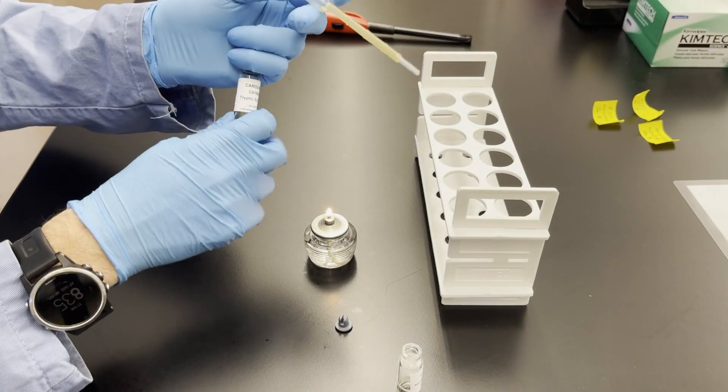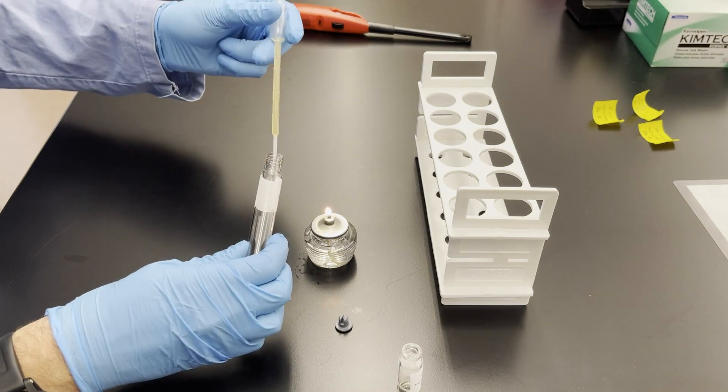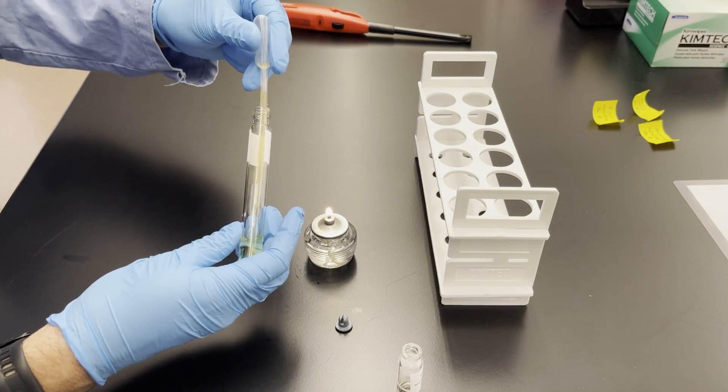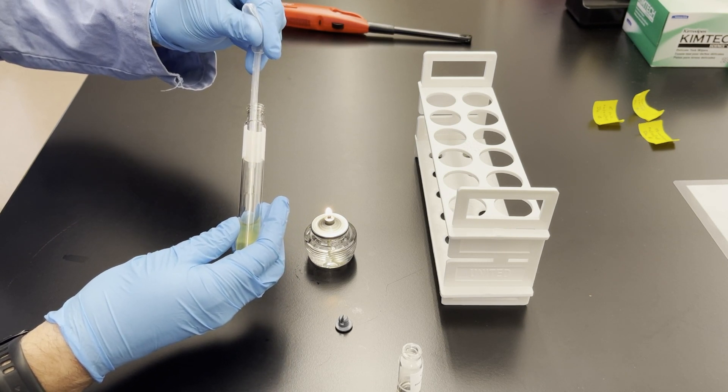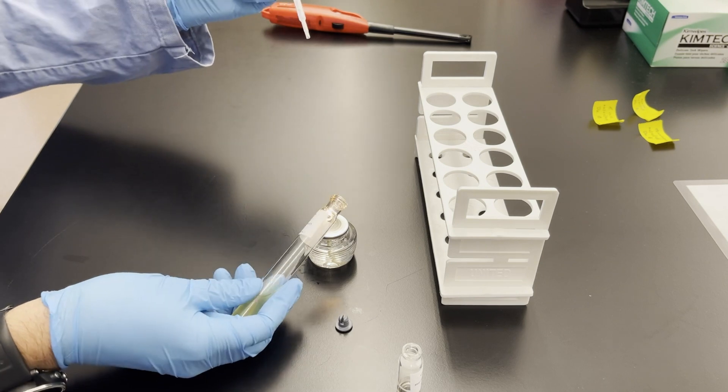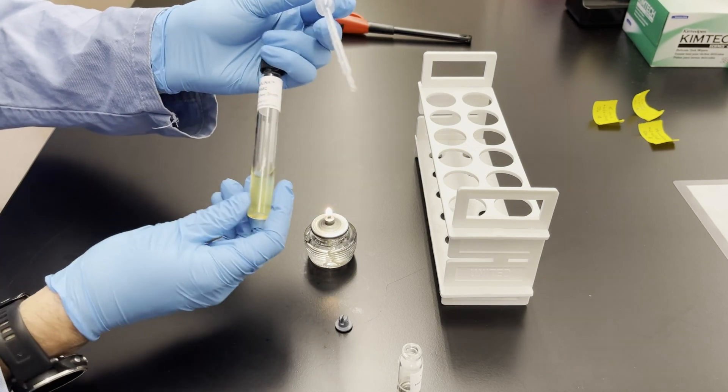And so then again when I open this tube I'm going to flame the mouth of the tube again just passing it through the flame and then dispense all of those bacterial cells back into this tube. And so again prior to closing this I'm going to flame the tube and recap it.